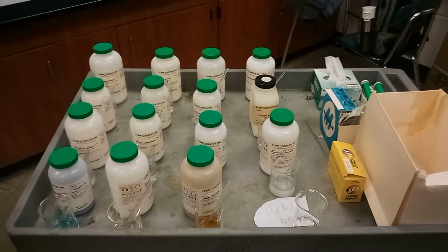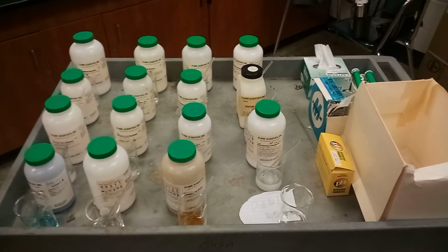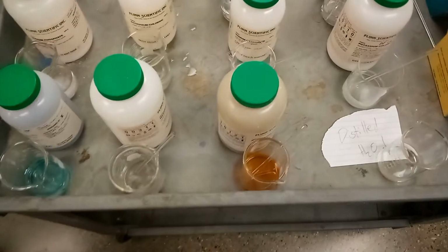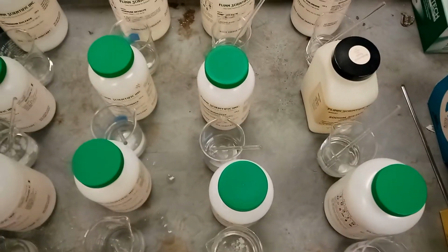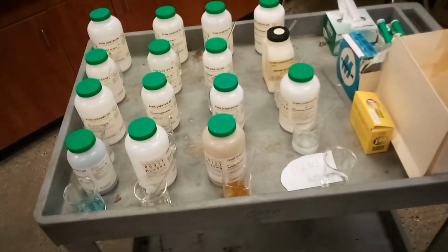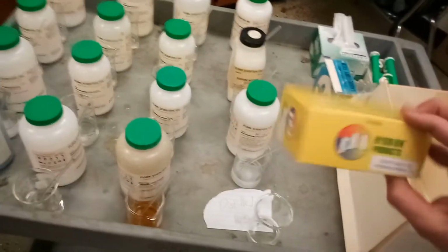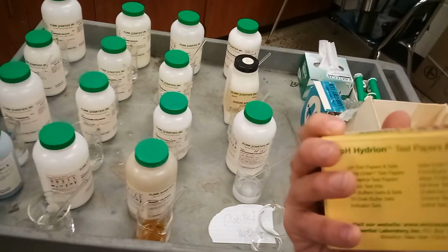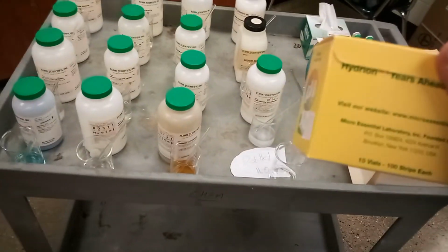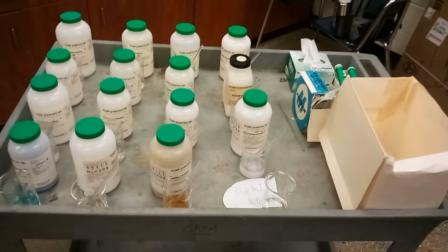So here are the 16 different salts, and in the bottom right hand corner you have the distilled water that we'll be using. We'll be taking different drops of each of these 16. You can see first row here, next row there, and the next row, all 16 of them there. We'll be taking drops and applying the solution onto this pH paper over here, which will help you determine the pH by using the color of the paper after the solution has been administered to it, I suppose you could say.